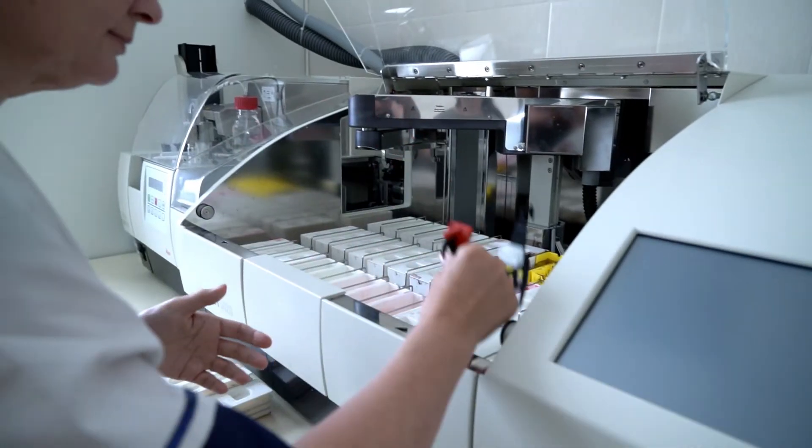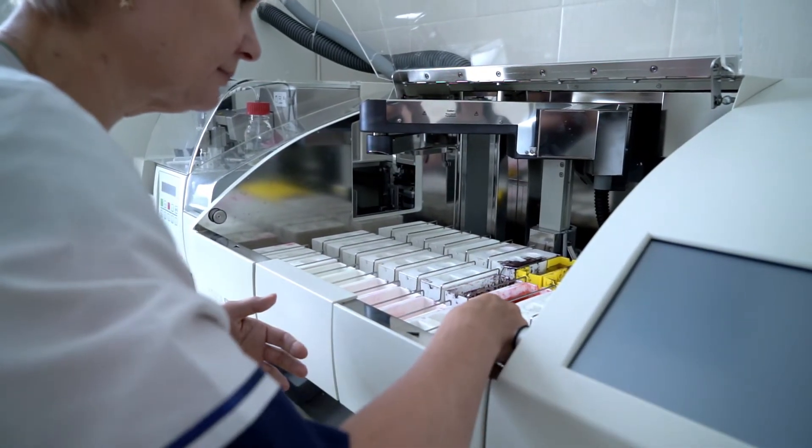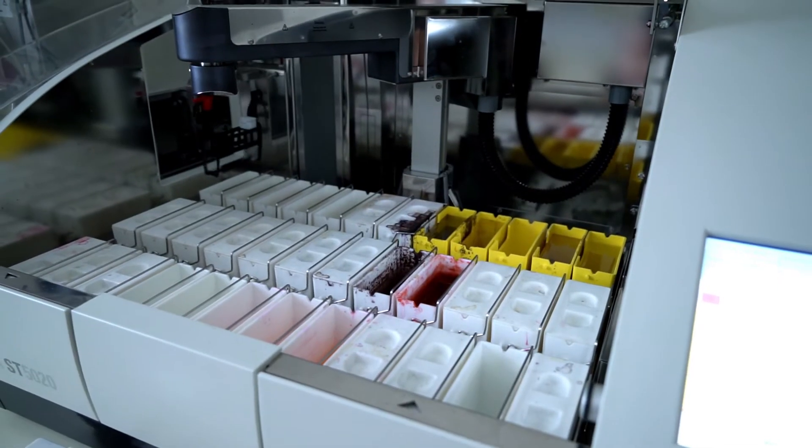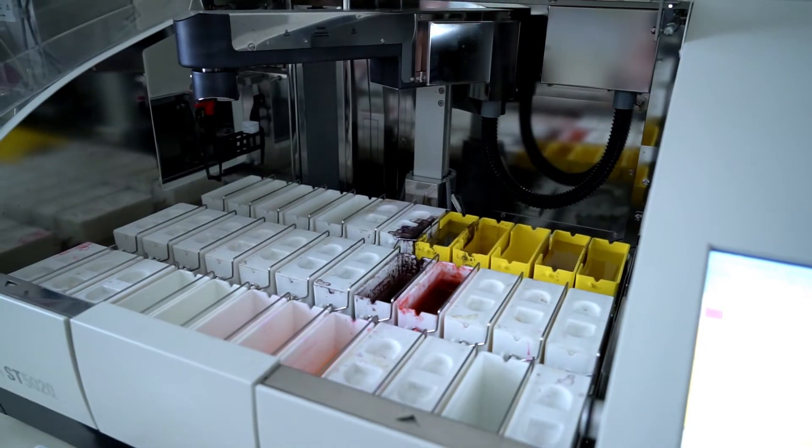Hello everyone! My name is Ksenia and I'm an application specialist at Biovitrum company. We continue our videos about histological studies. After processing, embedding and sectioning, we have to stain the tissue to observe its structure using light microscopy.